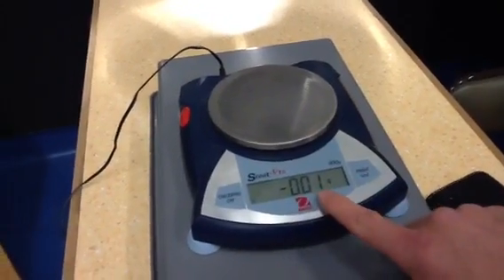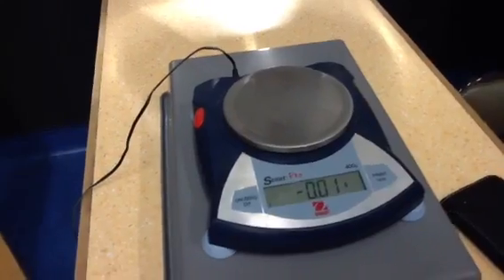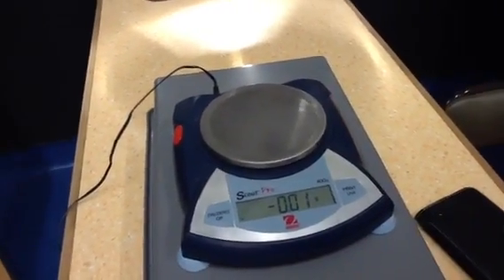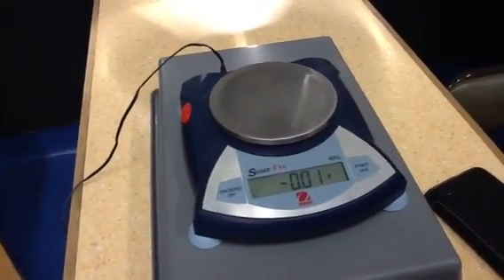You can see it's gone back to error, which is a little bit annoying. To be honest, I'd probably just go with 13.3 for that final reading, since it keeps doing this, and just say that I'm only confident up to three significant figures.